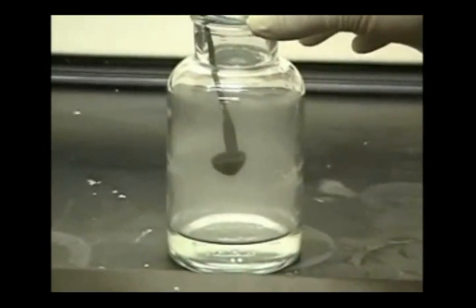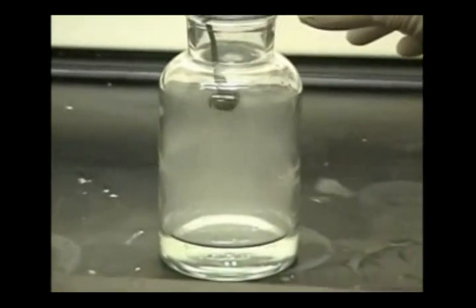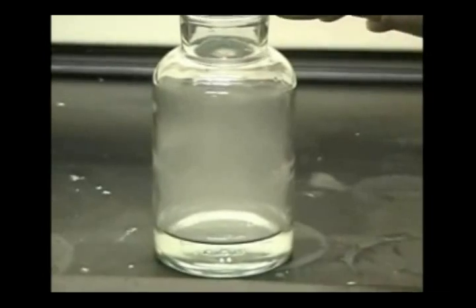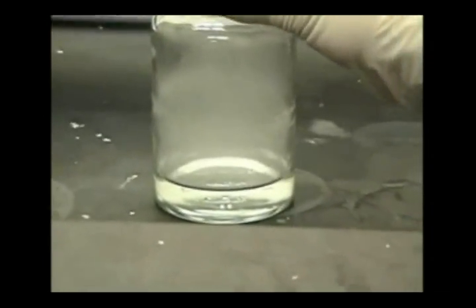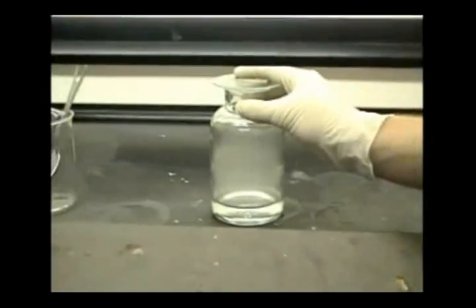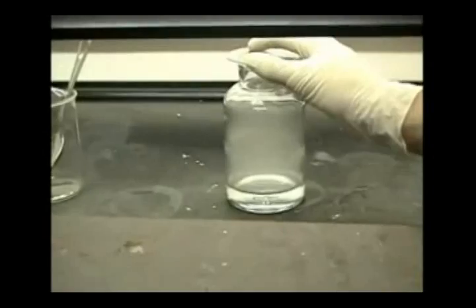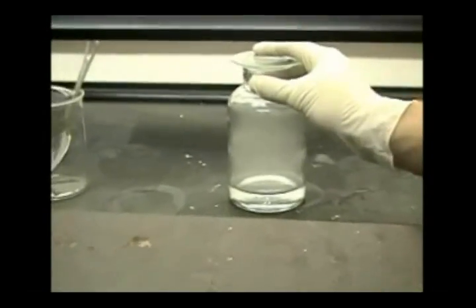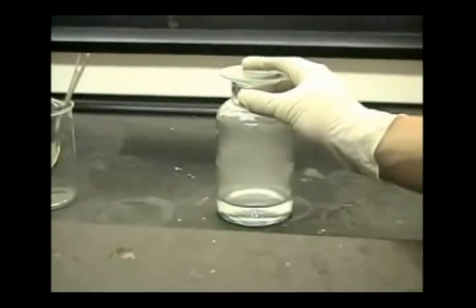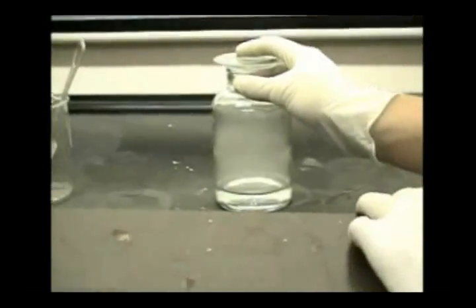Now we are removing the deflagrating spoon and quickly placing the cover glass back over the glass bottle, in order to retain as much SO2 gas as possible.